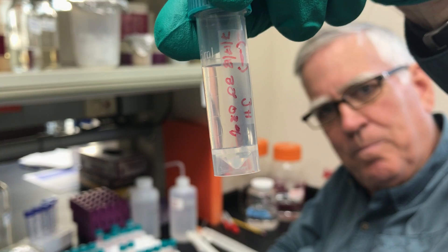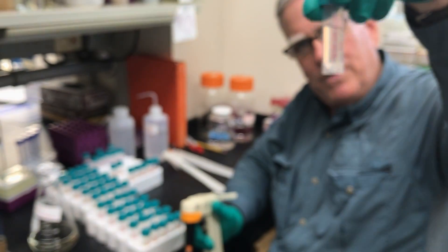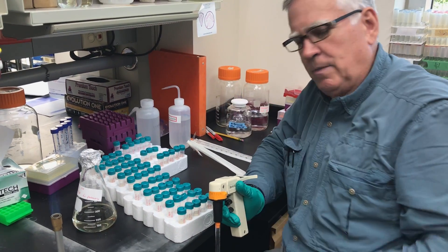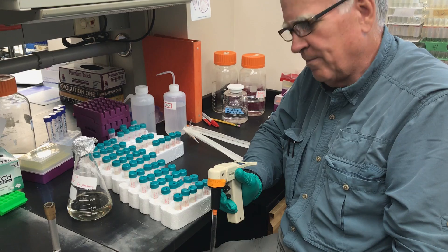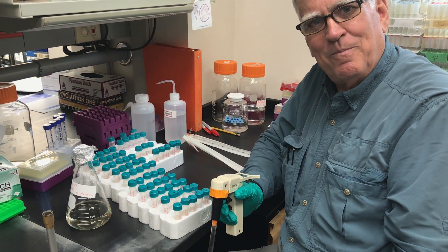I stopped after filling the first pipette and used a pipette to fill this one. This one is at 20 degrees. We're now doing one that will be incubated — is that the right term? Yep — at 30 degrees. And this is the assembly line in the Hibiter yeast lab, part one.